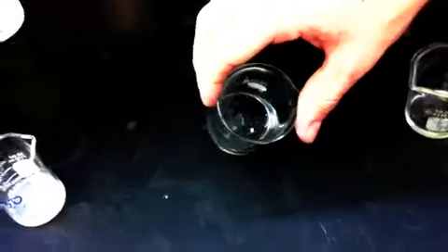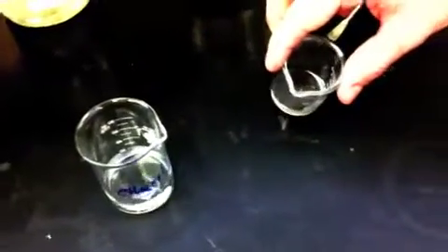If you bring it over here. Water, once again, it's not soluble enough at room temperature whatsoever. You have giant chunks. The ethanol, in this case, is very sparingly soluble. You can see the little chunks in the bottom, whereas compared to the water which is undissolved. And then the hexane, it's all dissolved at room temperature.